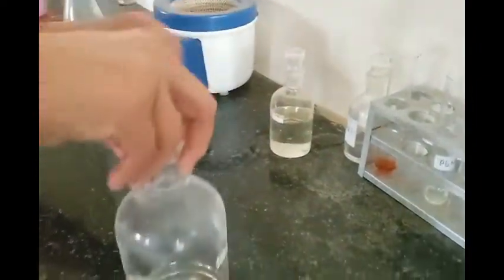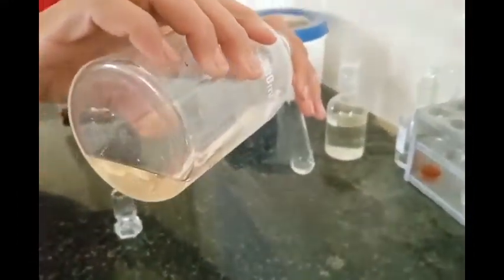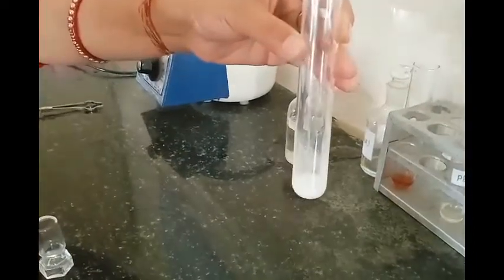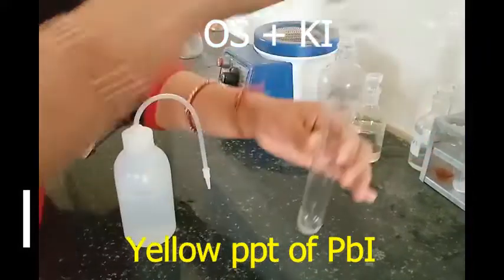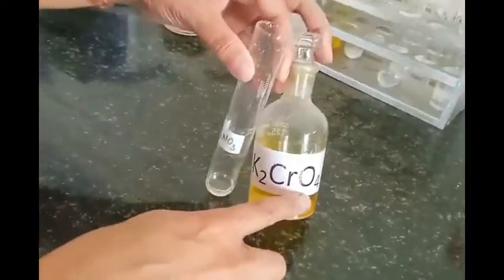Now, test for lead ions. I have divided it into three parts. In the first part, original solution plus concentrated H2SO4 gives a white precipitate of lead sulfate, as you can see here. In the second part, adding potassium iodide solution gives lead iodide as a yellow precipitate.